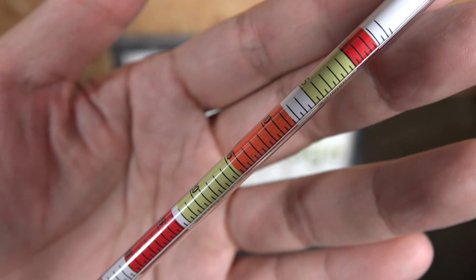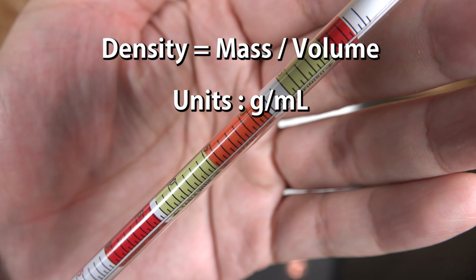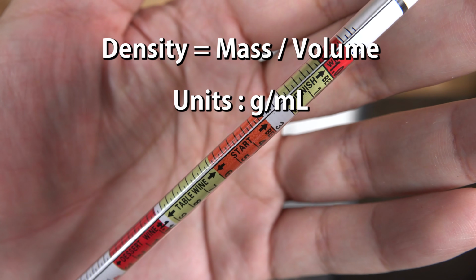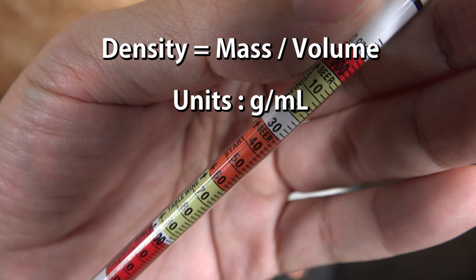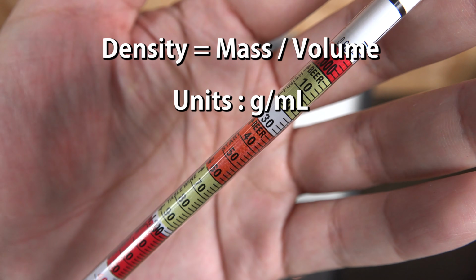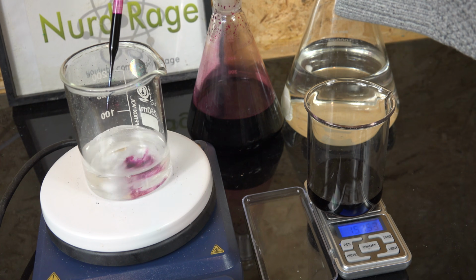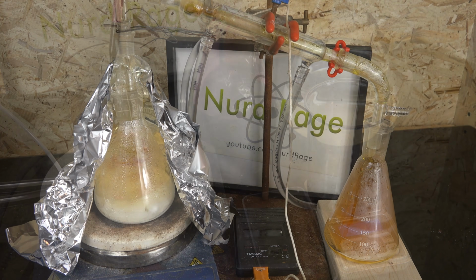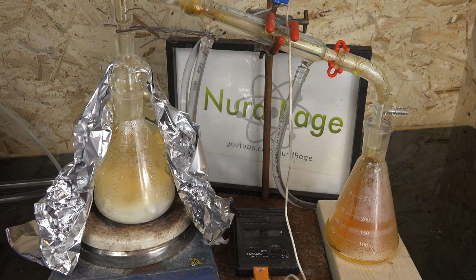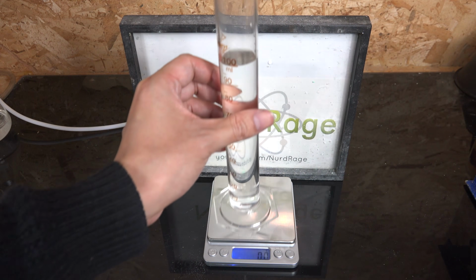So density is simply the mass per unit volume of a given substance and is usually expressed in the units of grams per milliliter. It's a simple but useful analytical tool because we can get information from a sample non-destructively. Unlike, say, titration, where the whole point is to completely react away the sample. For something as simple as measuring acid concentration, it's way simpler and faster to use density. And it's broadly applicable because everything physical has a density, and occasionally non-physical things like human minds, which can be exceptionally dense. First, the basics.